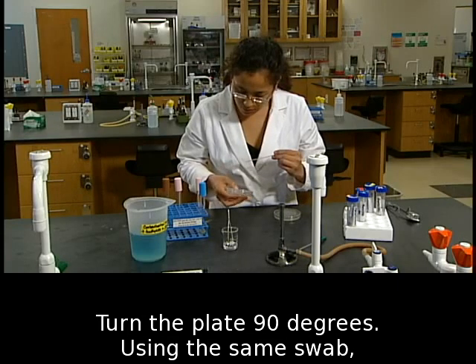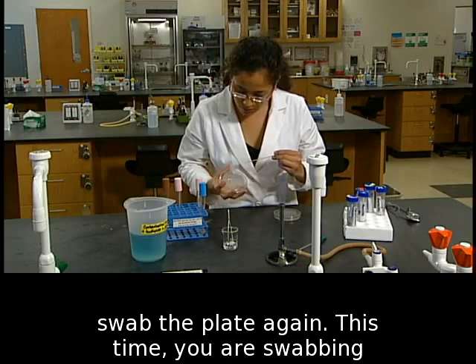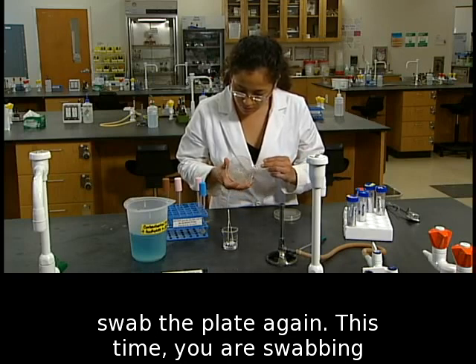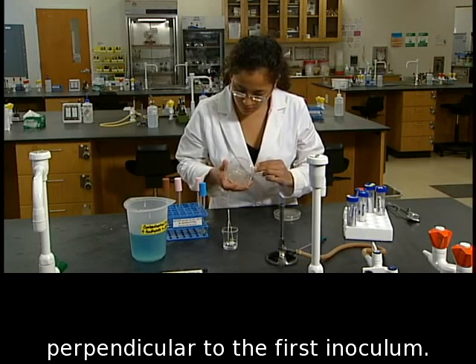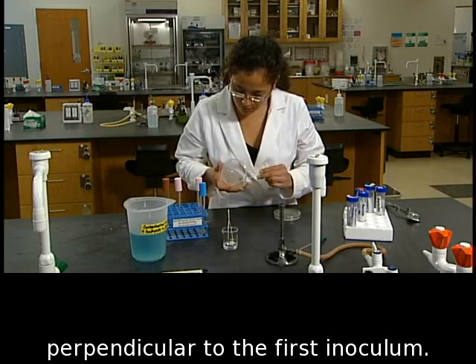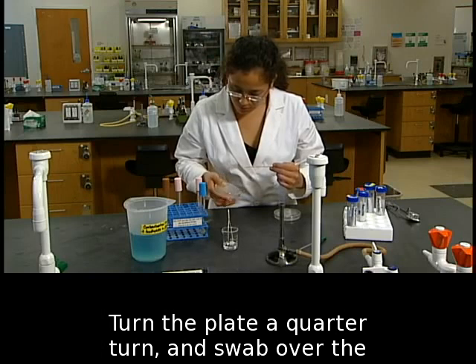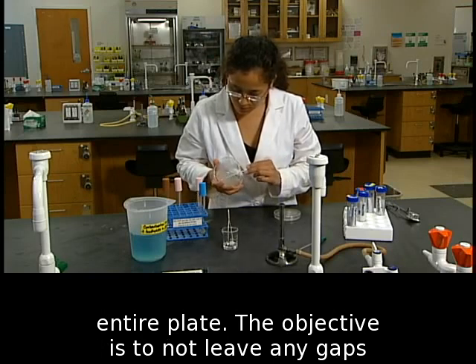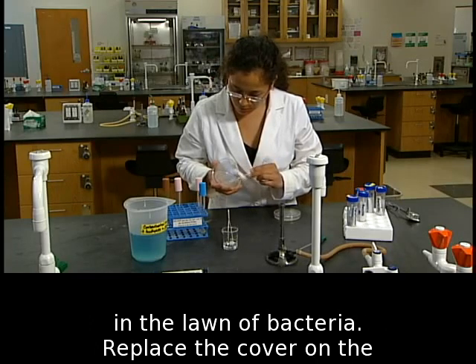Turn the plate 90 degrees. Using the same swab, swab the plate again — this time swabbing perpendicular to the first inoculum. Turn the plate a quarter turn and swab over the entire plate. The objective is to not leave any gaps in the lawn of bacteria.